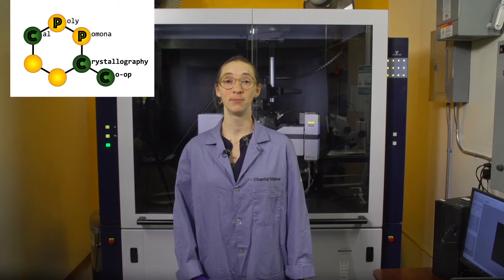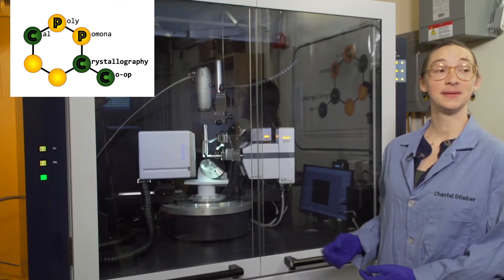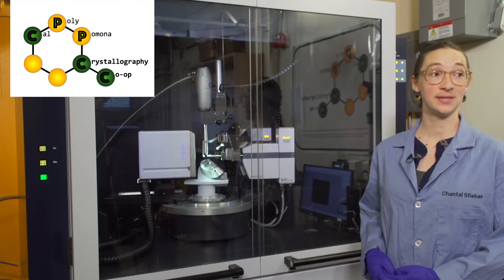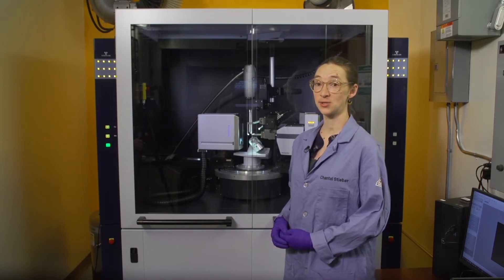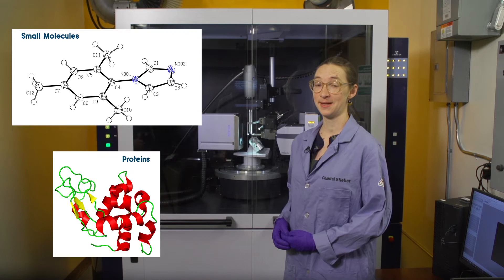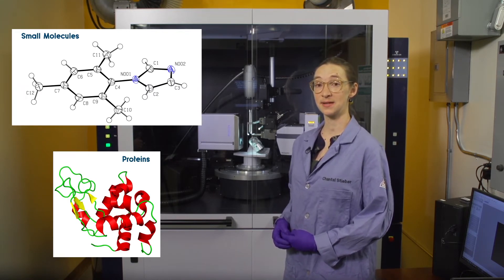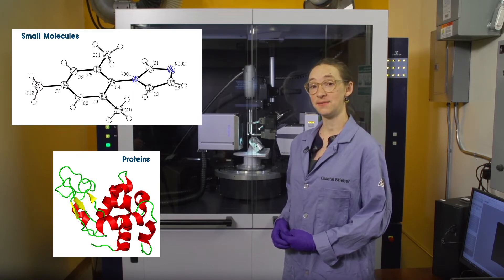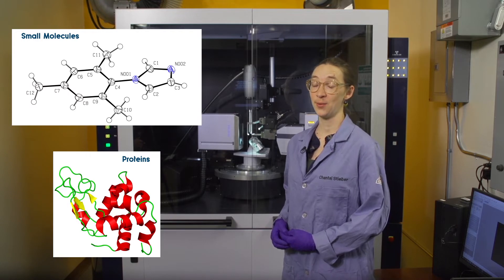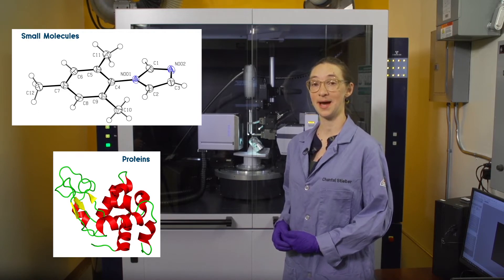The Cal Poly Pomona crystallography co-op houses a Bruker D8 Venture diffractometer with copper and molybdenum microsources and a Photon 2 detector. It is best suited for determining the 3D atomic structures of small molecules and proteins. This video series will primarily focus on using the instrument to collect x-ray diffraction data from small molecules. However, many of the steps are very similar when analyzing protein samples, and important differences between the two experiments will be highlighted.